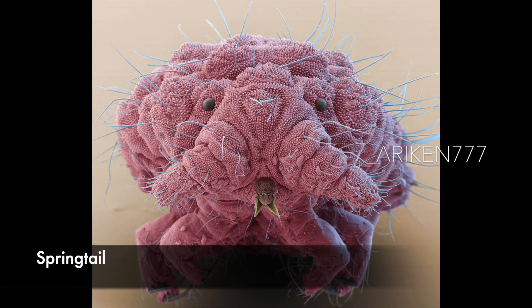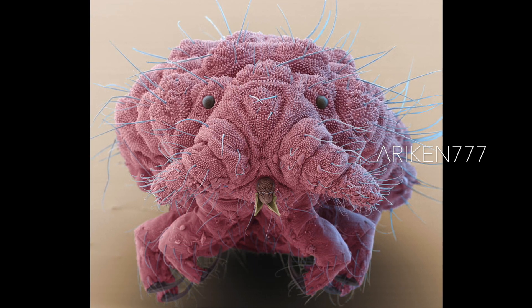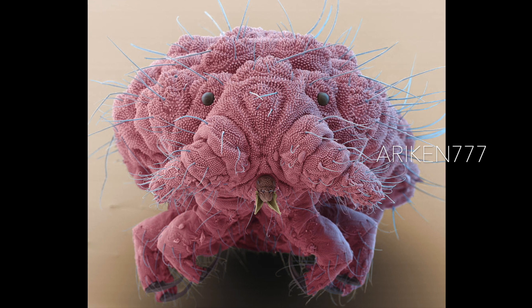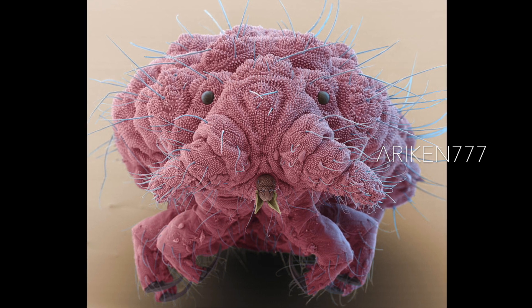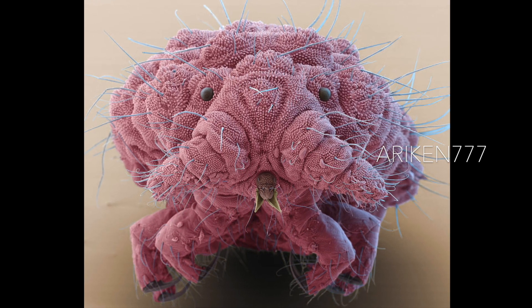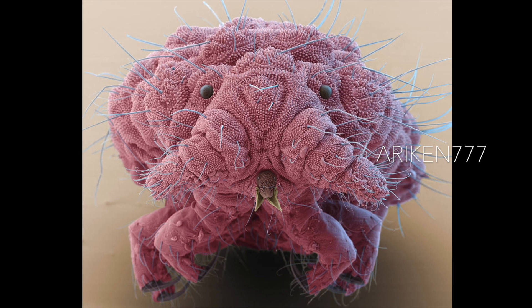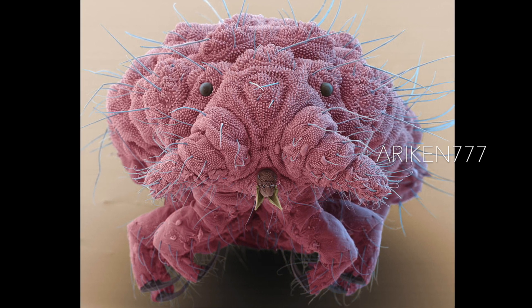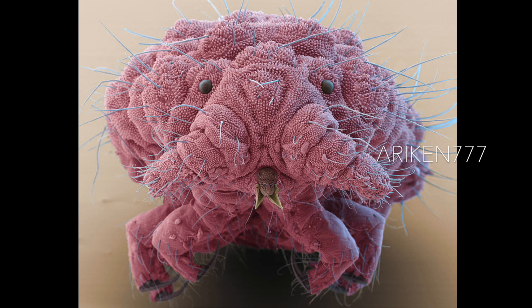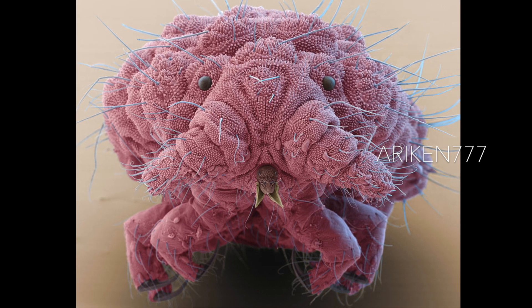This six-legged living fossil is a springtail. It has internal mouthparts, so it is not considered an insect. It is blind and feeds on bacteria and decaying organic matter. If it runs into a predator, it can flick its tail downwards to propel itself away — hence the name.